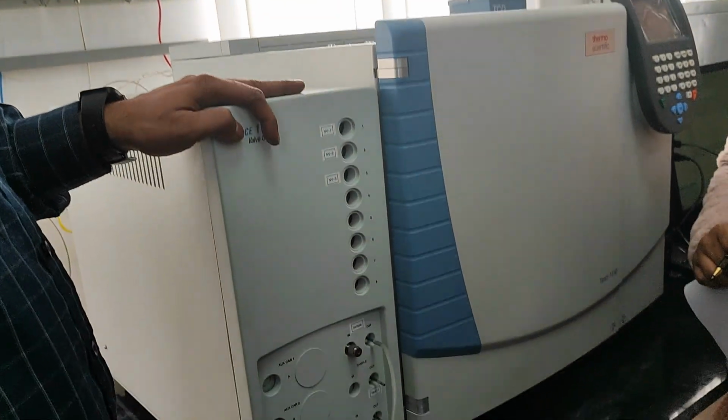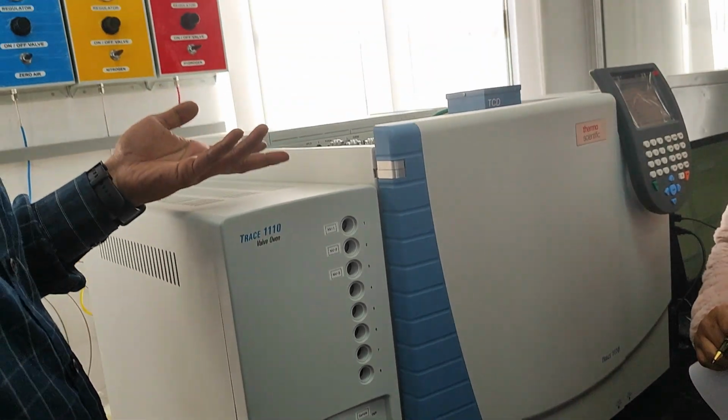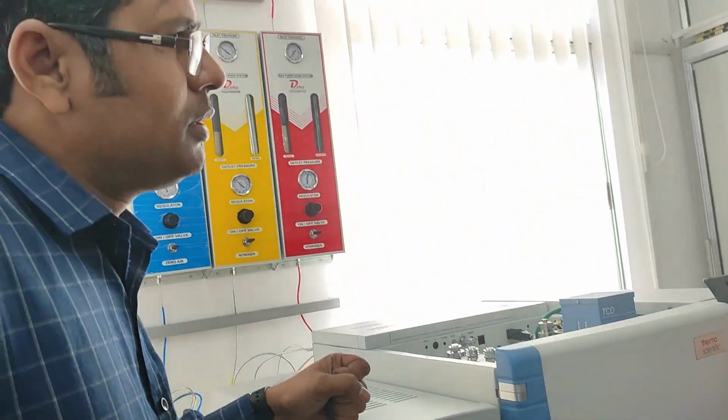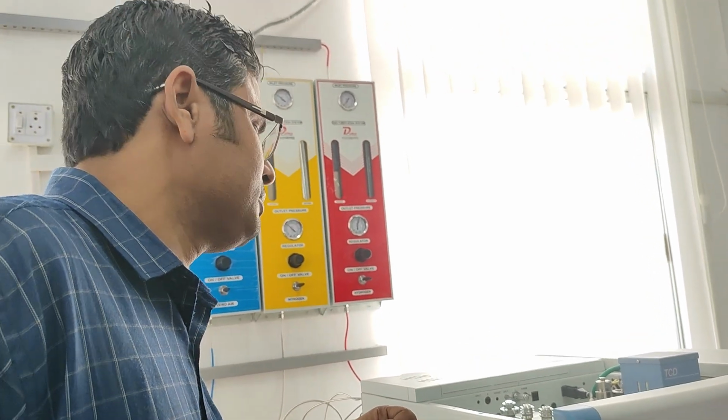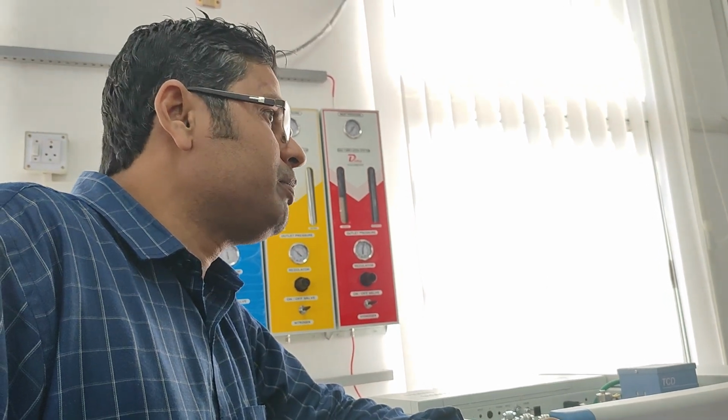because your sample is all at percentage level. Most probably methane is up to 80% in your sample. So 1 ml is okay. But I want to detect acetylene in ppm level, or I want to detect hydrogen in ppm level.